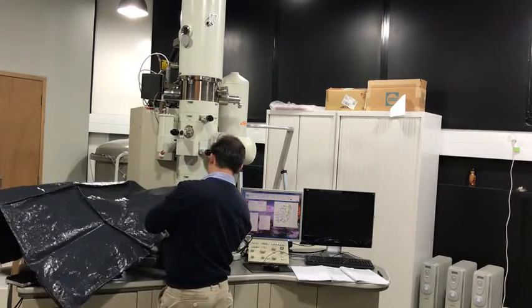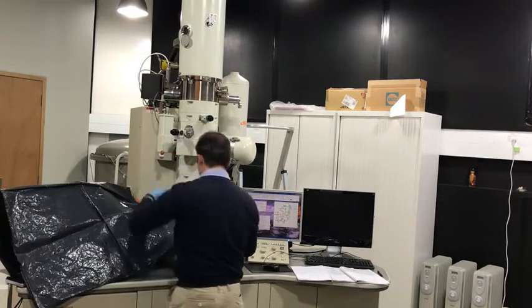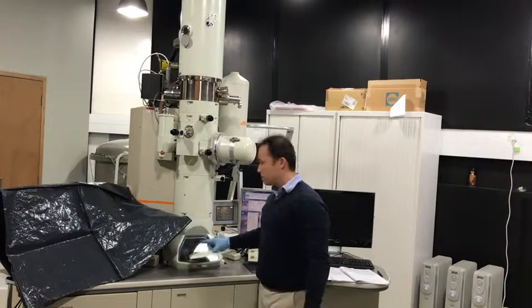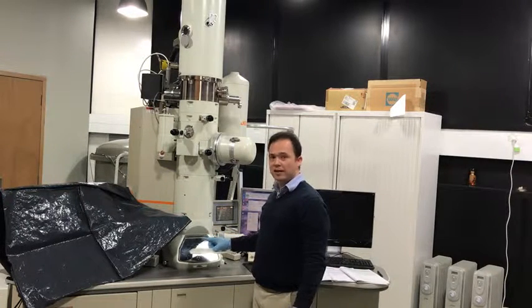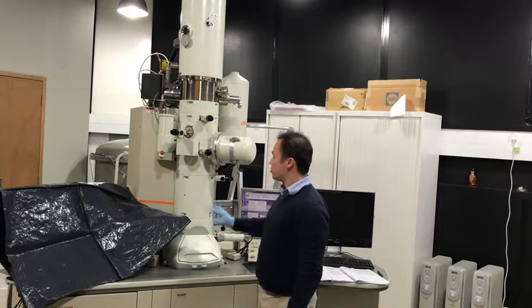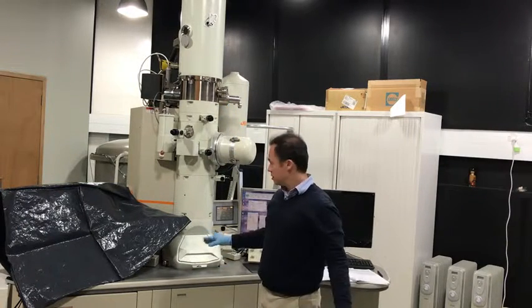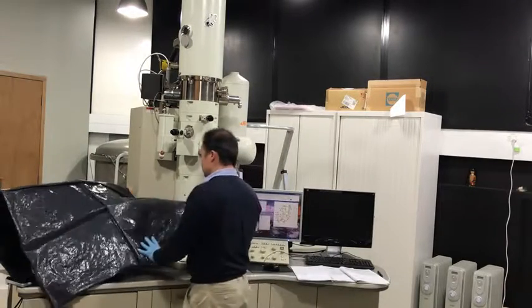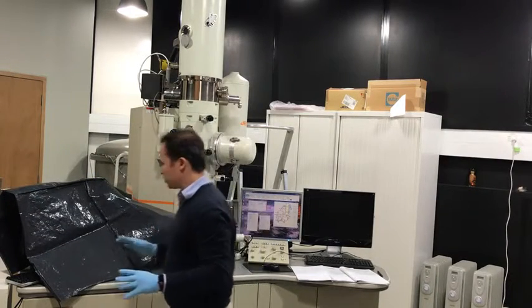So that's nicely covered. Binoculars gone. The main threat really is if liquid nitrogen lands on the viewing screen. Because this viewing screen is made out of a special type of high lead content glass, it's very susceptible to thermal shock. There have been many cases reported where people have been a little bit careless, a bit of liquid nitrogen flew onto this glass and shattered it. And that glass there is worth $10,000 a piece. So hence the care taken to protect everything.